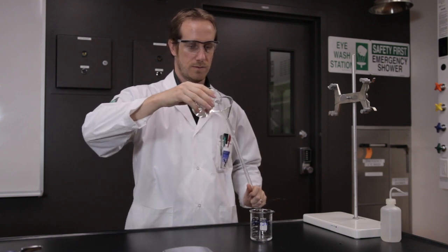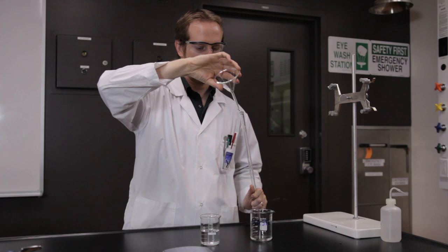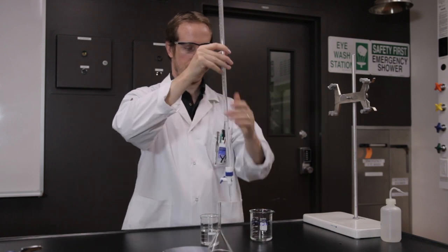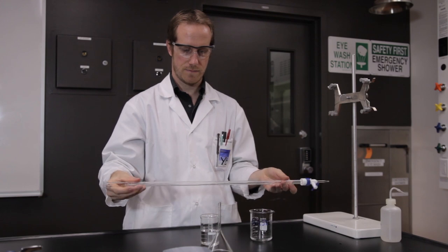Rinse the burette by adding about 15 milliliters of the sodium thiosulfate solution from the stock solution beaker into the burette using a funnel. Record the concentration of the sodium thiosulfate solution.